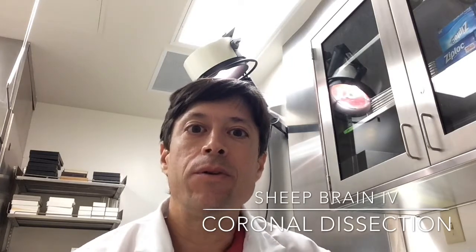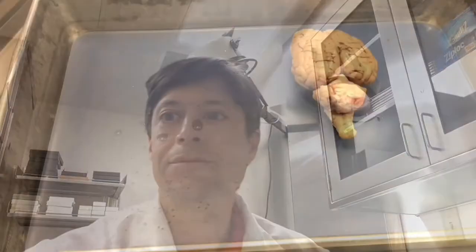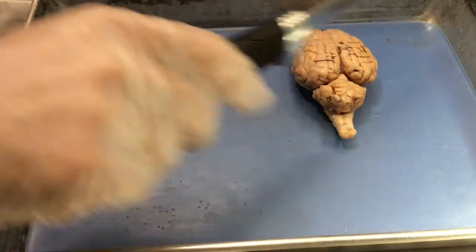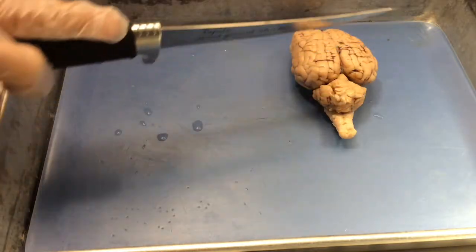Today we'll be doing coronal sections, which is a type of cross-section. Coronal sections basically refer to cuts that are perpendicular to the long axis of the nervous system.